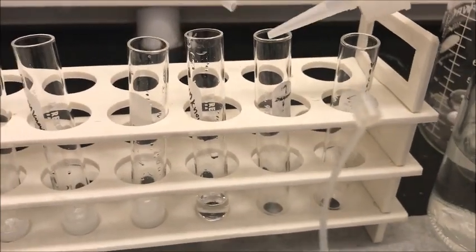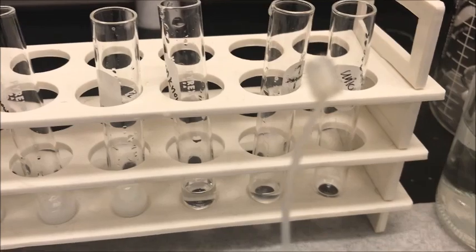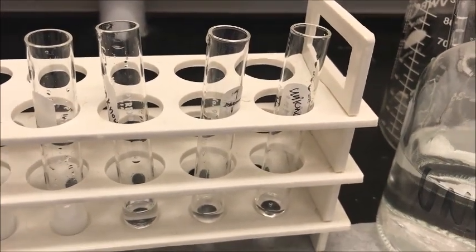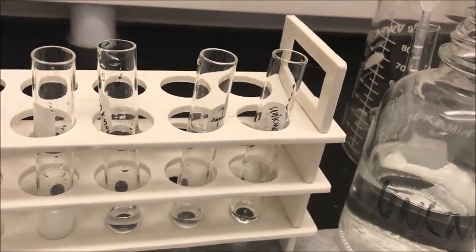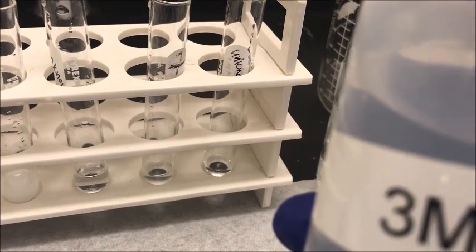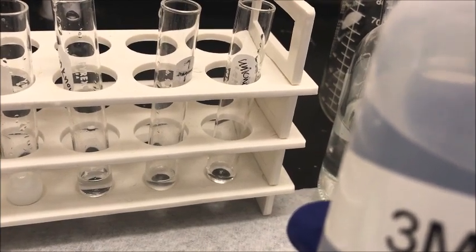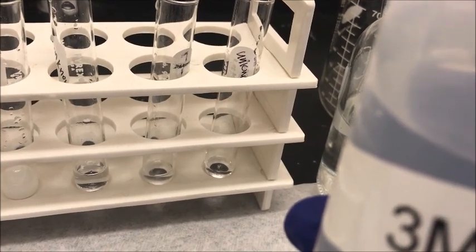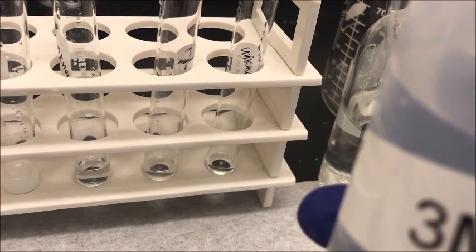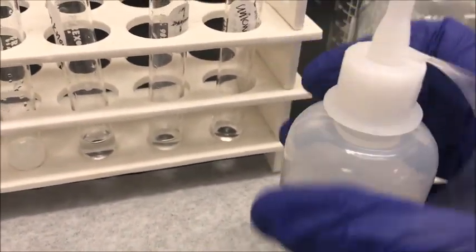Next we test for carbonate ions. Add 1 ml of carbonate to the next set of test tubes and 1 ml of unknown solution to the unknown test tube. Then add 5 drops of 3 molar hydrochloric acid to each sample and watch for a strong evolution of CO2 gas bubbles as you add the HCl. The gas bubbles form quickly and may be overlooked, so if bubbles were not observed, add another 5 drops of HCl as you watch the solution. The evolution of gas bubbles indicates the presence of carbonate ion.